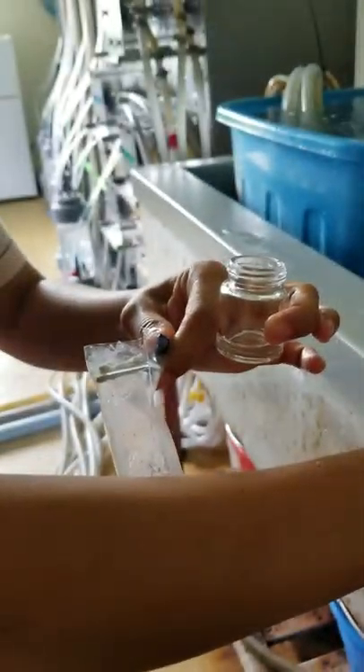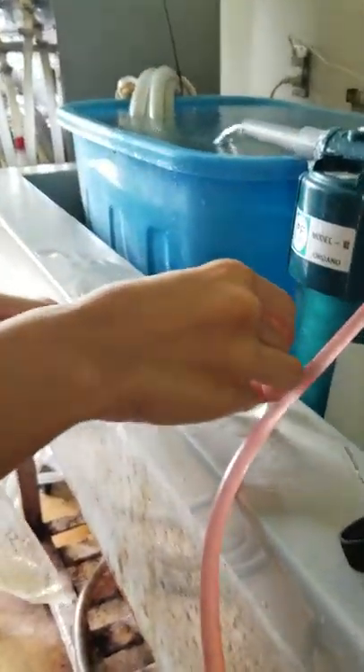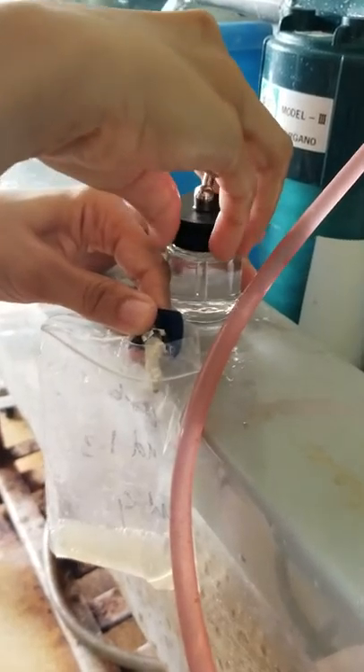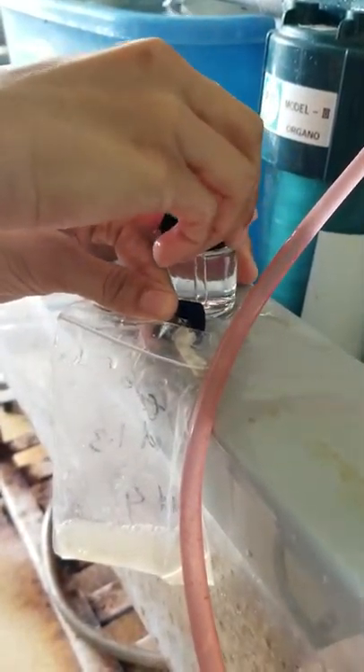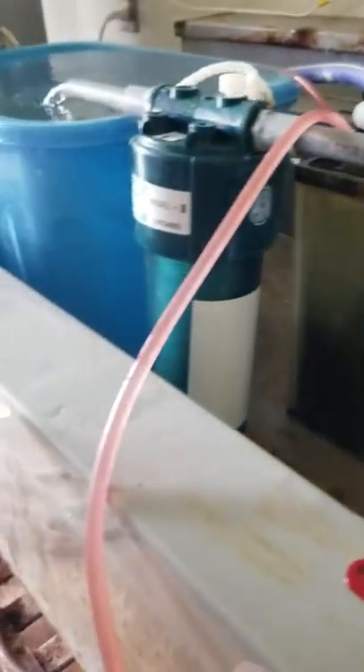Sorry, we finished our water so we have to fill it because this container is so small. For me, I can use this one for two nubbins. To fill it, we need filtered seawater — for our filtered seawater we have 10 micron and 1 micron filtration.